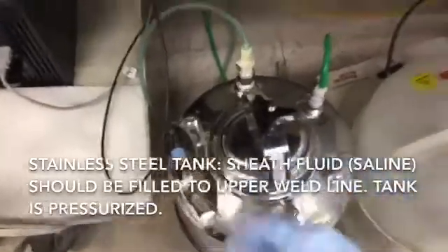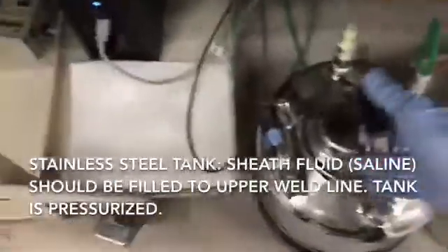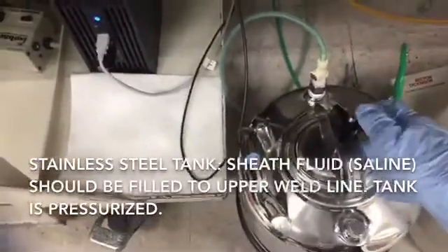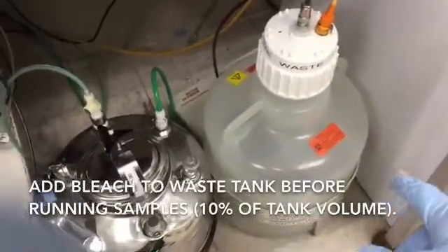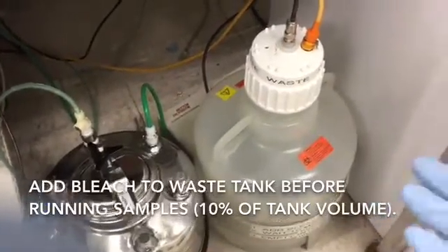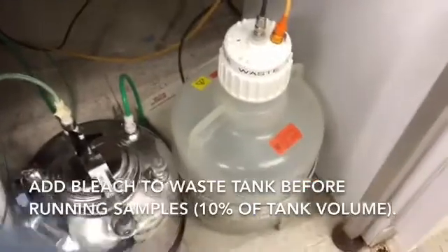The stainless steel pressure tank is for sheath fluid — that's the saline that runs the instrument — and the plastic carboy is for the waste. When you get to the instrument, the previous user should have filled the sheath tank; you can usually tell it's full just by jostling it. The waste tank should also be empty. Typically, we have people put some bleach — up to about 10% of the volume — in the waste tank prior to dumping it. If you do that when you get started, it has time to sit with whatever you're putting into the waste to inactivate it, so it's a good idea to add bleach when you start your run.